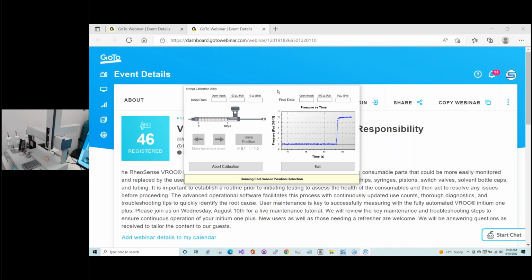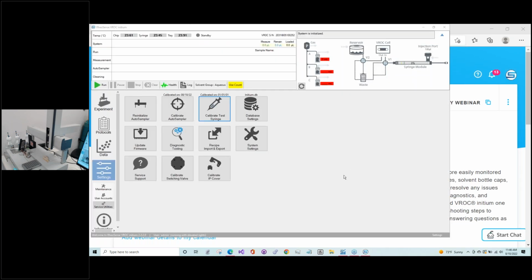Okay. So you'll know when it's done, because it'll say calibration complete at the bottom. And so once that's done, you just hit exit. And then you are all set to go.